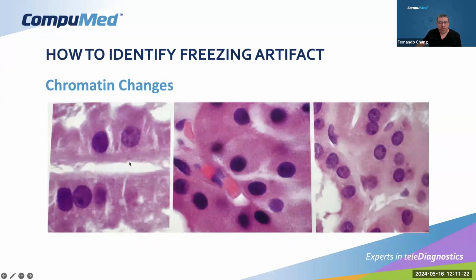Then we have this type of chromatin changes. This is finer, and this is obviously for our pathologist to determine, because we're examining the nucleoli here. But you can see to the left is the frozen section original. And you can see to the right exactly how the permanent looks, all the way to the right. That's the permanent, and then left is the tissue with chromatin changes. These are two examples of different tissue, but you can see how the chromatin actually changes when it's exposed to that. You can see fragmentation also of the cells, the cytoplasm of the cells to the left.